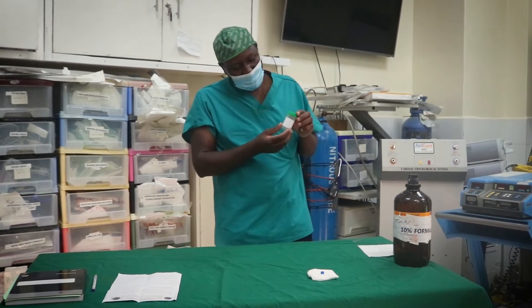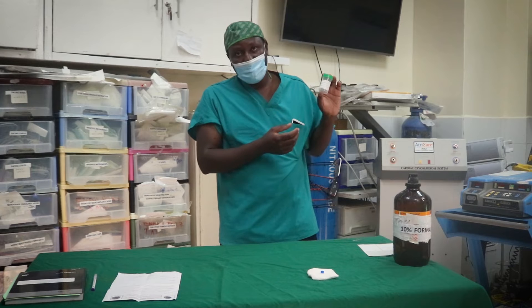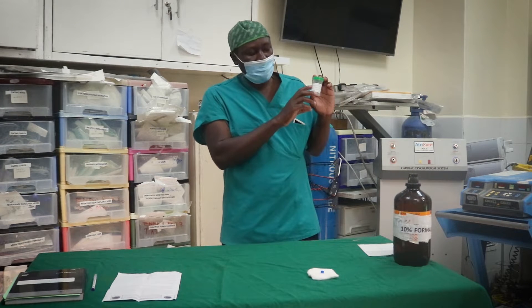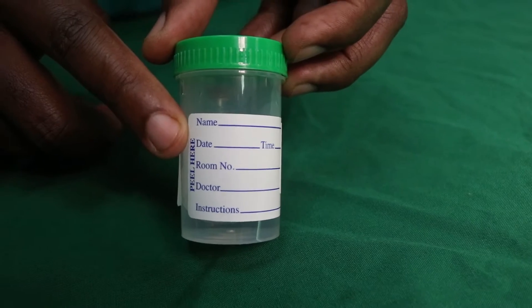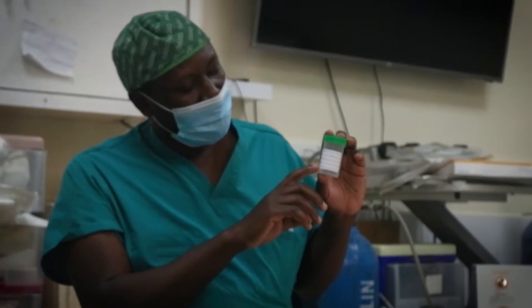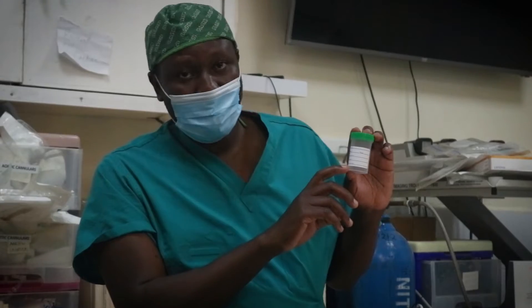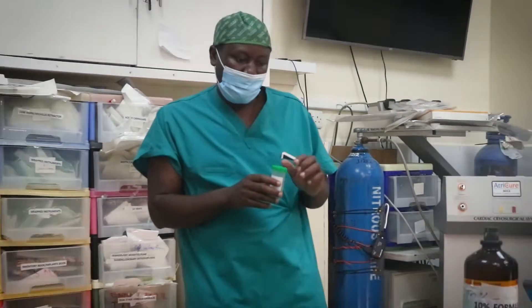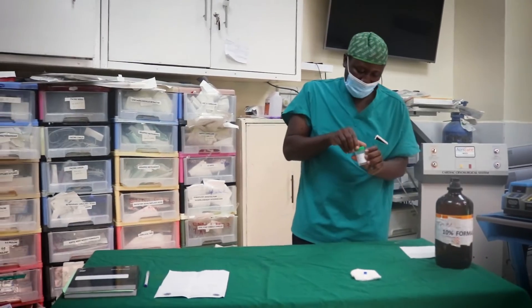Our containers are labeled and they have the name of the patient, the date, the room in which the procedure has been performed, the name of the doctor, and the specimen. What you need to do is open the container.